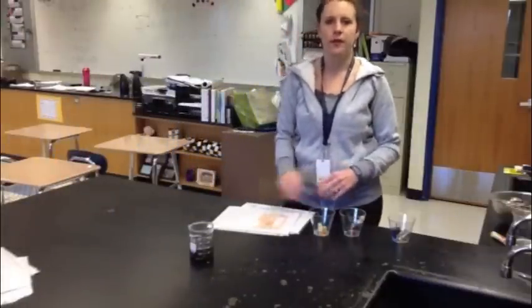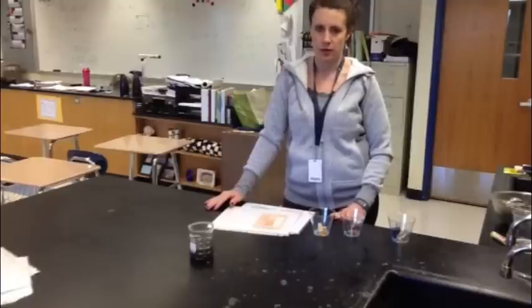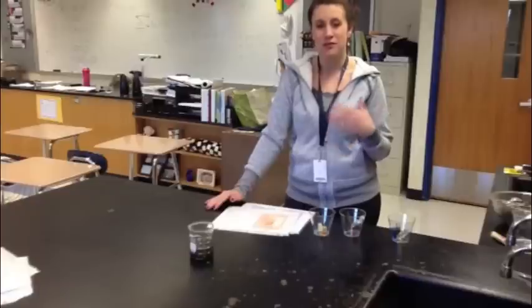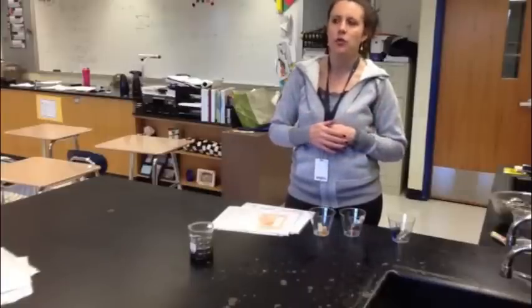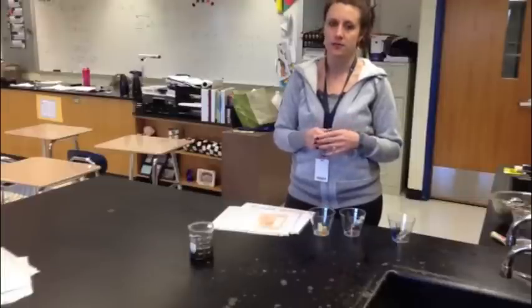This station is Station 4. Station 4 is a test for the nutrients found in the soil. What I mean by nutrients is basically how many vitamins, minerals, and elements you can find in the soil, and depending on how much it has, that could tell you how healthy the soil is in order to grow different kinds of plants.